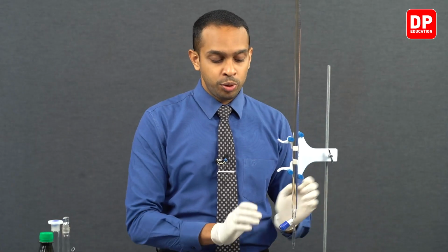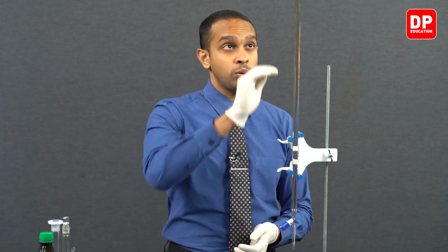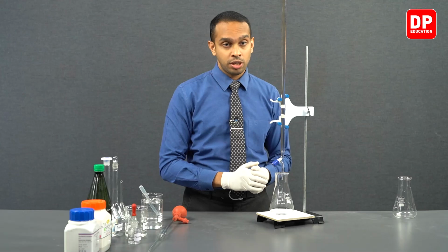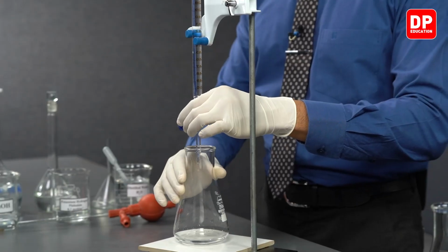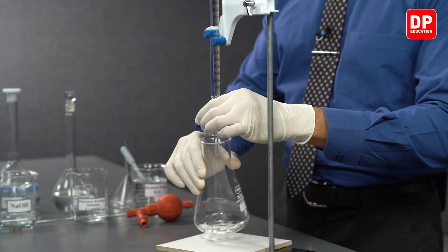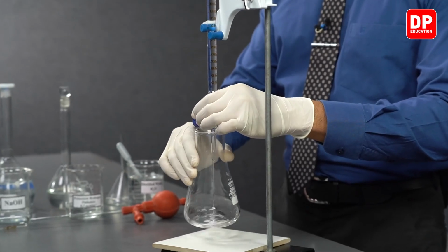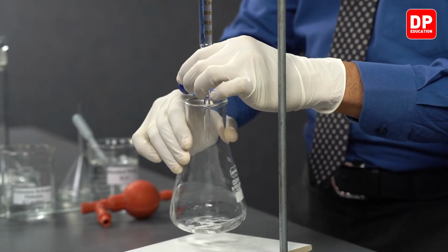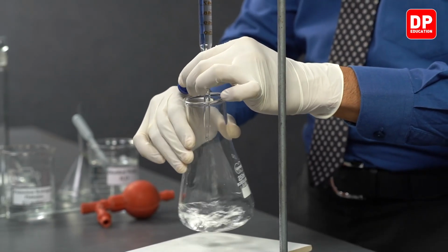After mixing the solution well, we can move on to conduct our titration. We have a burette here that is freshly filled with the sodium hydroxide solution that we prepared earlier. So the burette is filled all the way up to the 0 line. We can place the titration flask under the burette like we did in the previous instances, and we can proceed to titrate the potassium hydrogen phthalate like we did in titration 1.